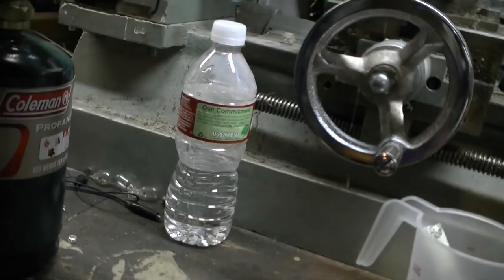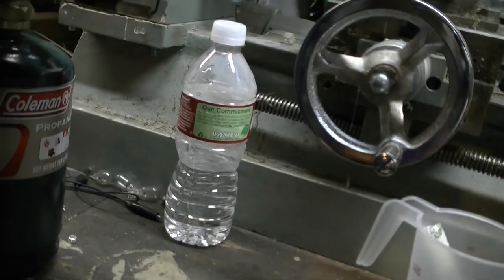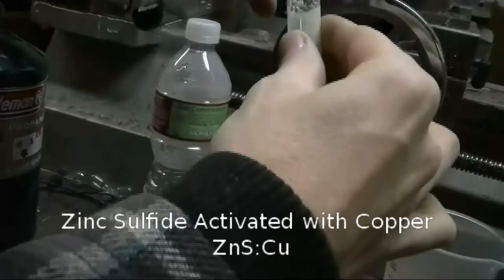This reaction yields copper metal, it's kind of spongy at the bottom, and a clear solution of zinc sulfate. I mixed that with my zinc sulfide glow powder.